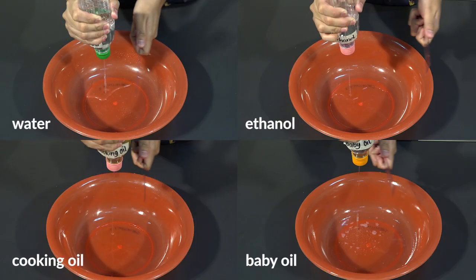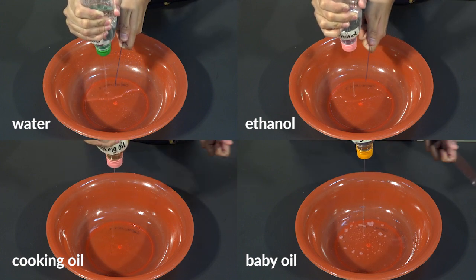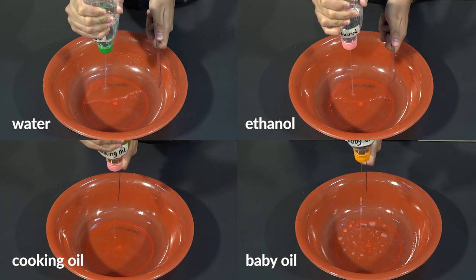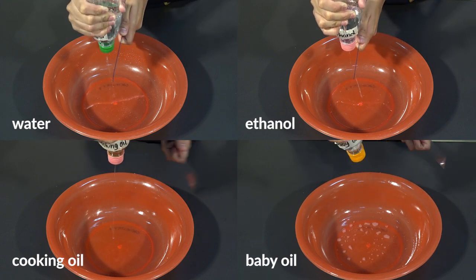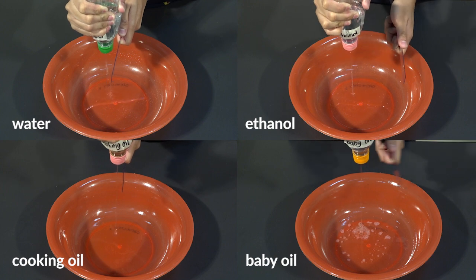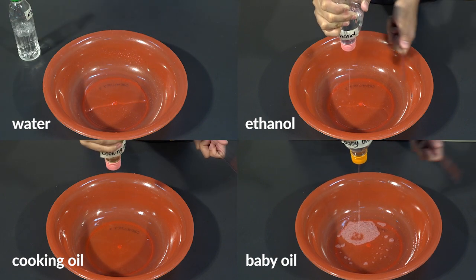There you go! That would be all for our post-activity discussion. Before we end this video, let us check the key concepts that Teacher Jackie and I presented to you. In this video, using a charged plastic ruler, you were able to determine the polarity of water, ethanol, baby oil, and cooking oil. Both water and ethanol are polar liquids, while baby oil and cooking oil are non-polar liquids.